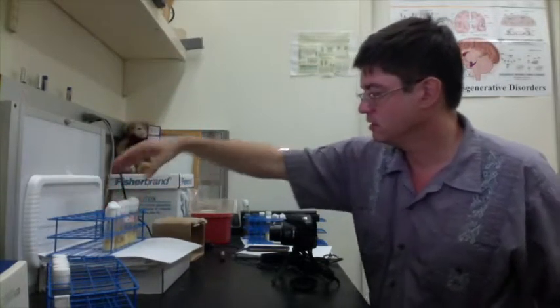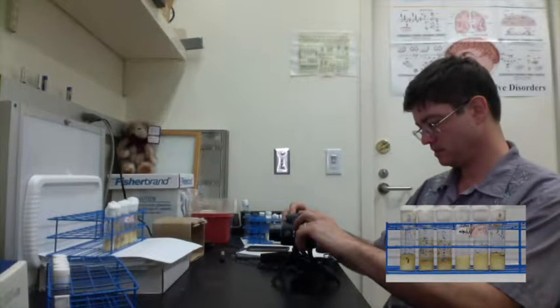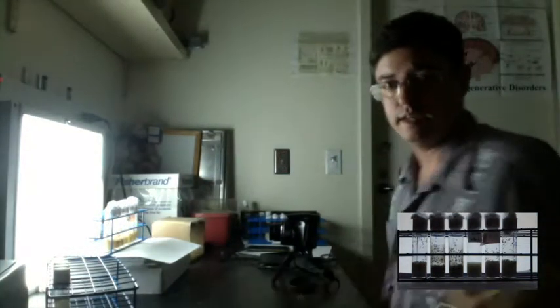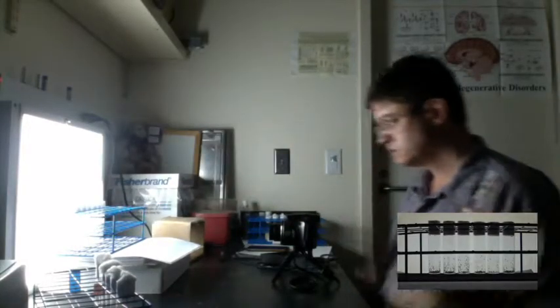So the first thing we're going to do is have the original stack, the original vials here, and I'm going to take a video. So I start the camera, let it focus on the vials, and now the recording has begun. I'm going to turn off the rest of the lights here, and I'm going to perform my assay. So my flies, they're in the correct order, and alright, I'm just going to do it. Okay, here we go. Okay, let them fly up.